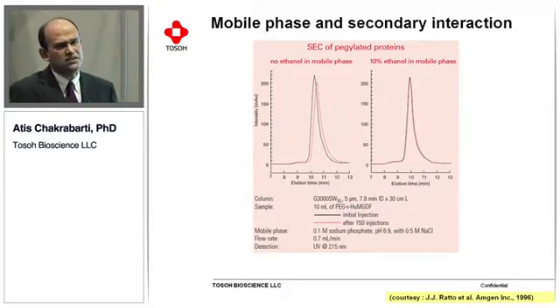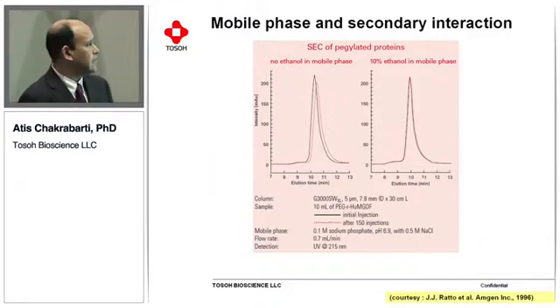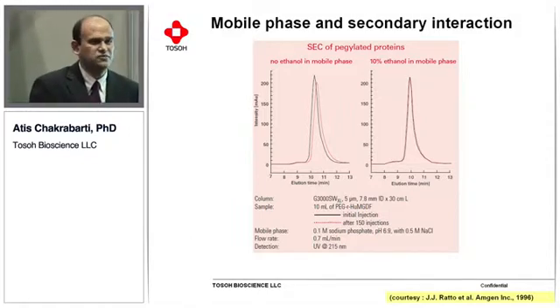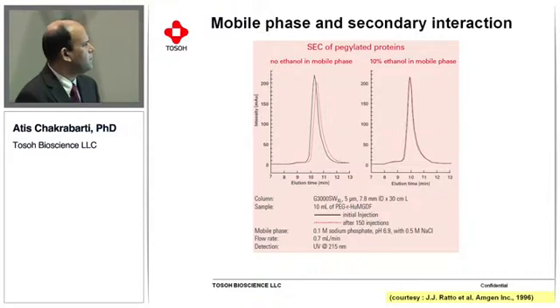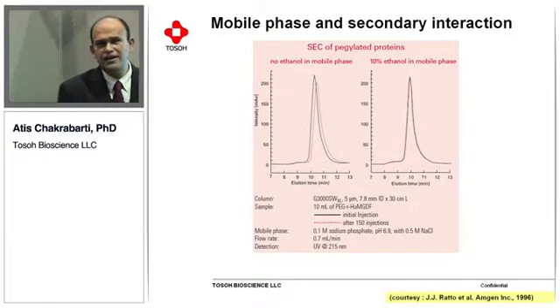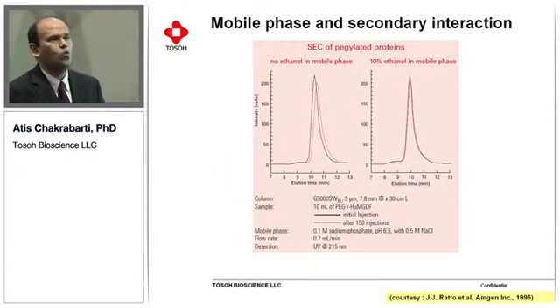So, it is not just arginine; we have done many different studies using different types of additives. As you see here, we have done the separation using pegylated proteins, and as you know, secondary interaction is very common or expected with PEG-related proteins. Over 150 injections, the retention time gradually shifts to higher retention time if you do not have any additives. But if you have additives, like just 10% ethanol in the mobile phase, you can run 150 injections without any retention shift.